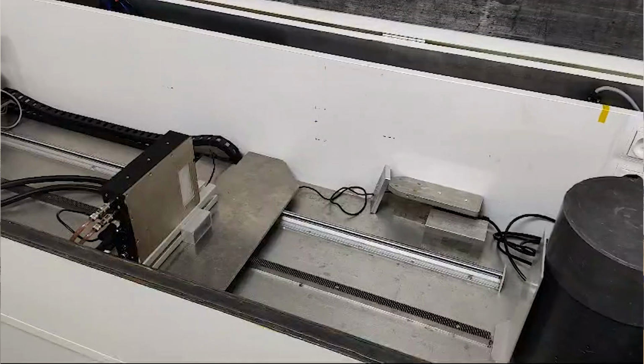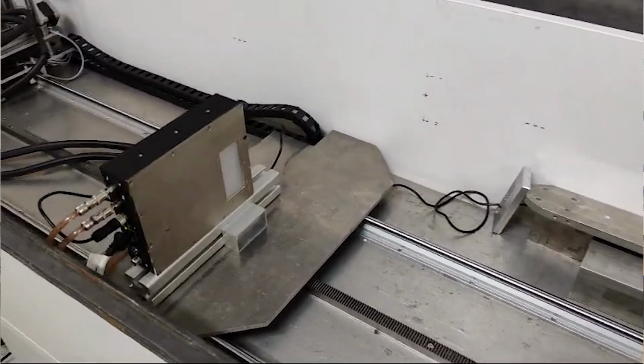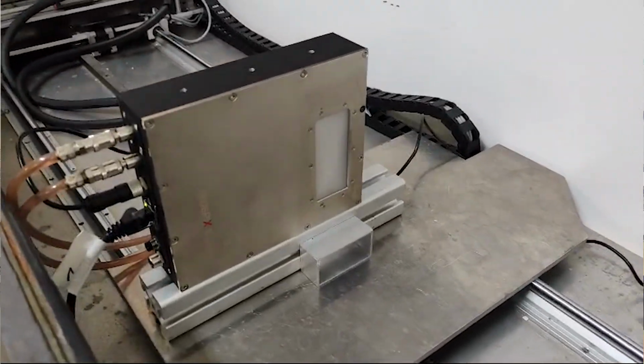So how to do this? First of all, you need to take a flat field image. This is an image without your sample, and you will use this later as a correction in PIXet. To get a flat field image, just remove the sample. You can put some sort of flat filter in front of the X-ray source, for example, an aluminum plate or a flat piece of PMMA.